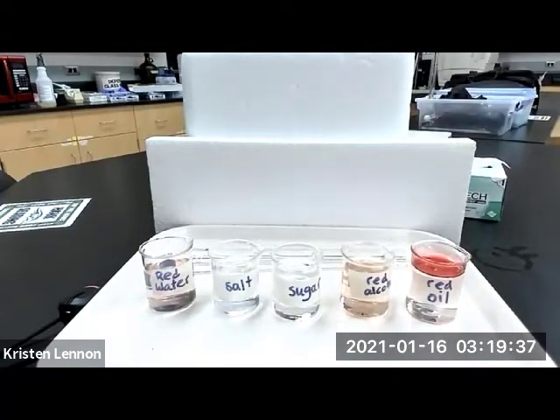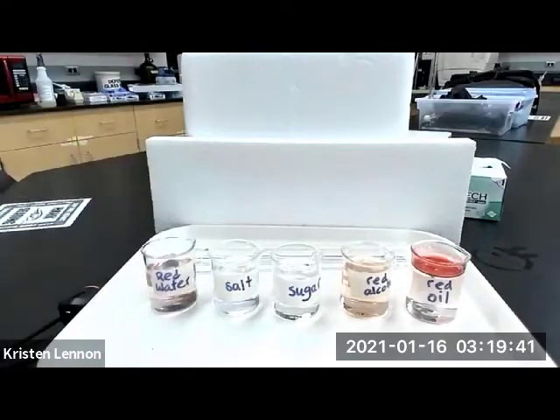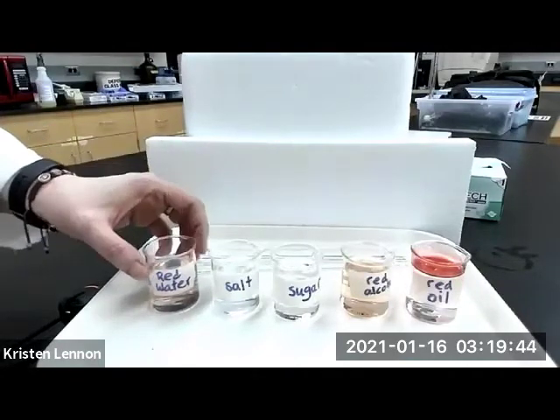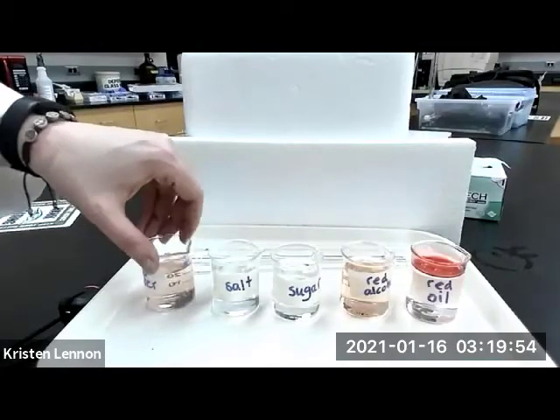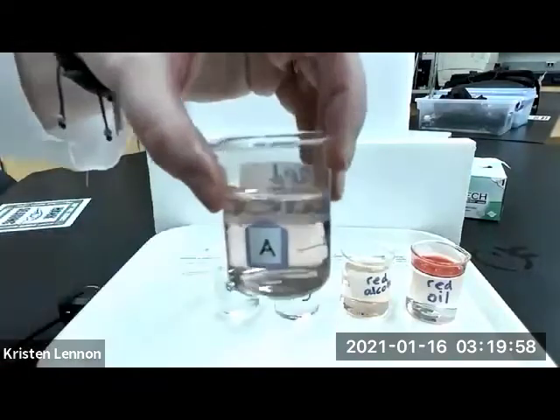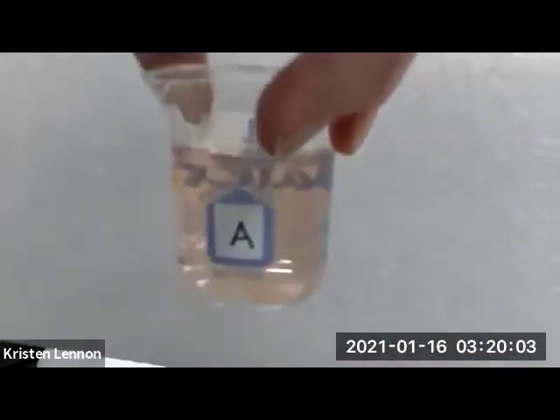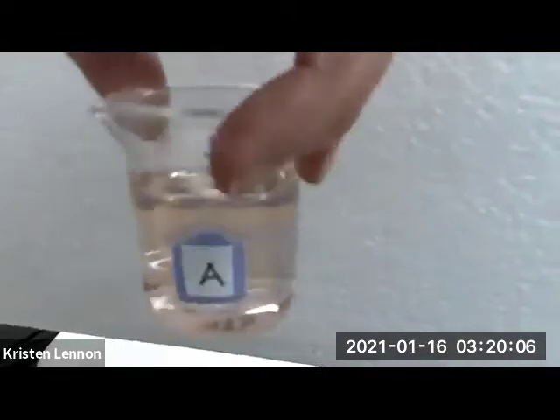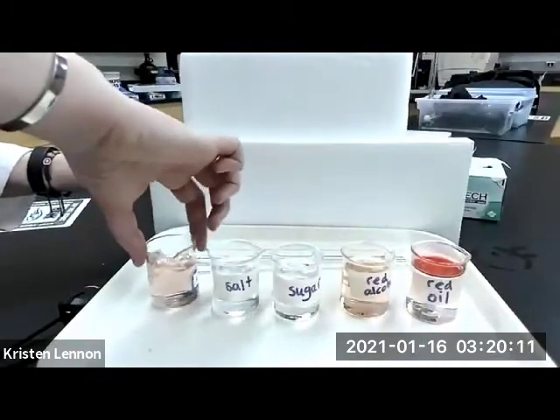Let's take a look at what we have found. Okay, I am going to hold up each to the camera. And I want you to look to see if you can tell that there is a separation between the two materials or if it seems uniformly colored or dissolved. All right, there's A. I'm going to put white behind it, so maybe that will help you see. There's A. See if you see a separation. This is the red water.